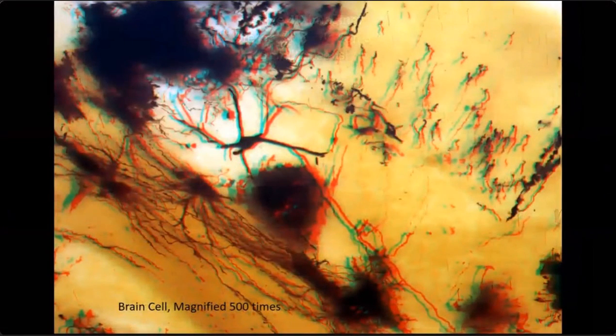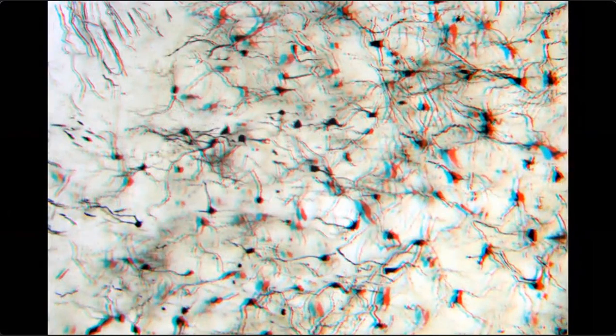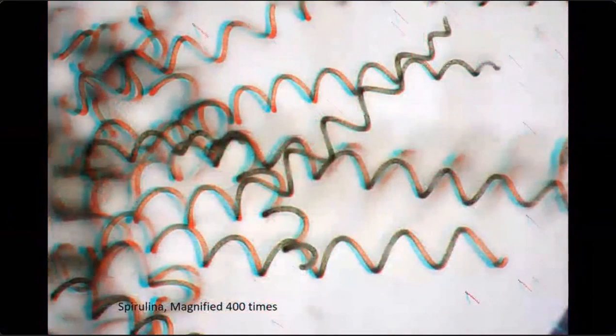Here's some, this is 135 microns thick, a single neuron from the brain. You can see clearly all the neurites going in different directions. Here's the cortex, a bunch of neurites in the cortex in 3D. There's some small blood vessels and tiny capillaries. And without the 3D, you'd have a really hard time telling what's actually happening there.